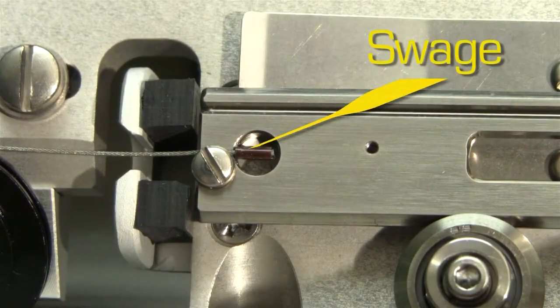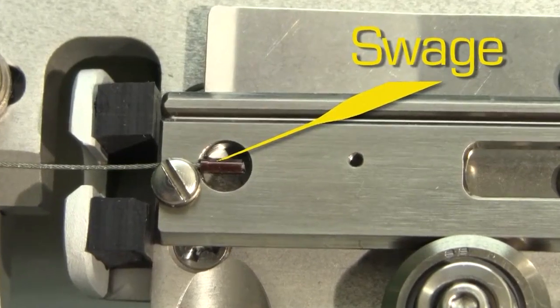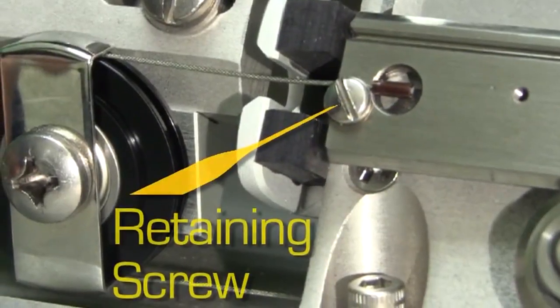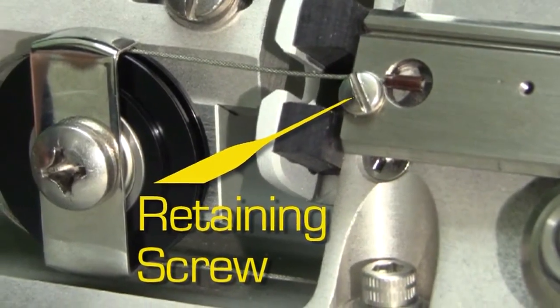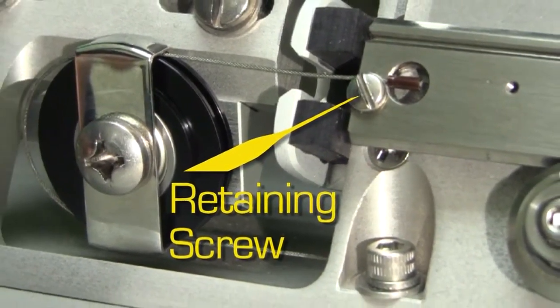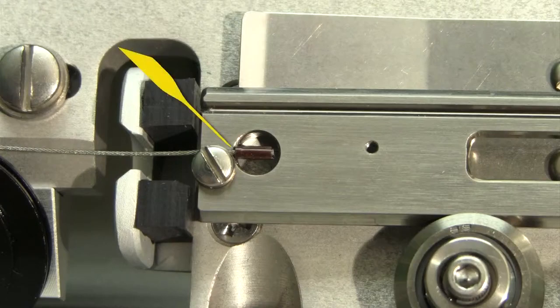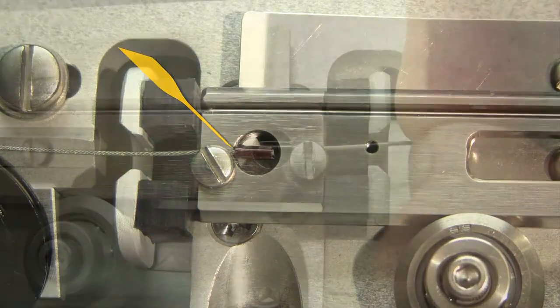The end of each pull cable is terminated with a crimp-on swage. The majority of the pull force is transmitted to the puller bar by the cable retaining screw. Inspect the cable retaining screw and the swage on both sides. Here's how it's supposed to look. The cable is firmly clamped and the swage is parallel to the puller bar. If there's a little gap between the swage and the hole in the puller bar, that's perfectly okay.